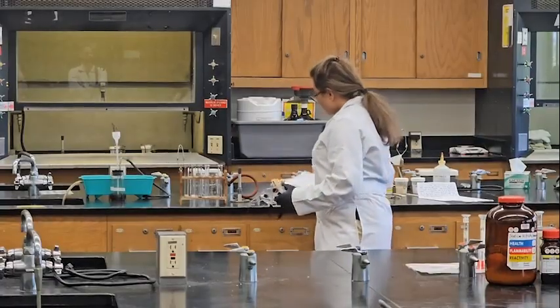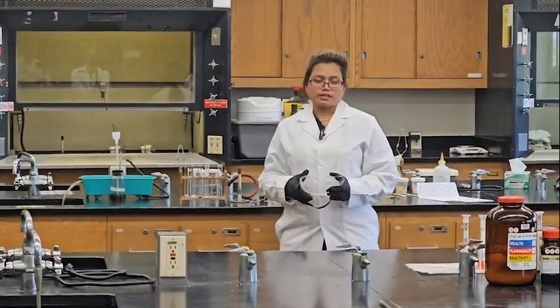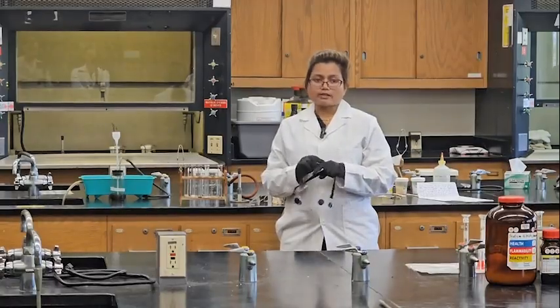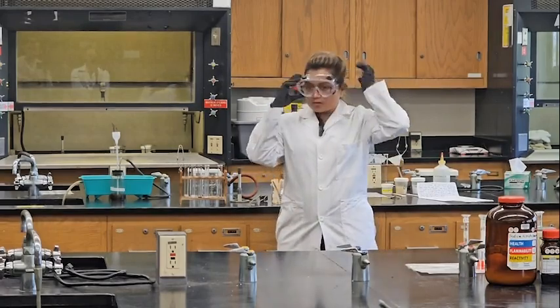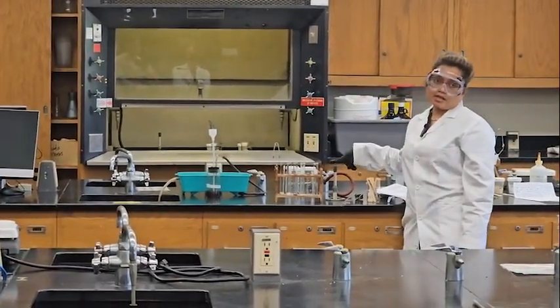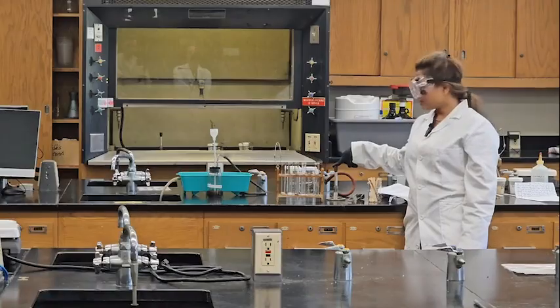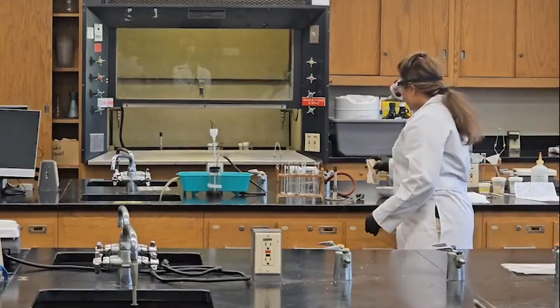As we do the lab, we need the safety protocols we explained before. We need gloves and goggles. Also, whoever has long hair should tie it up, because we are going to use the Bunsen burner. We don't want any harm to happen to you, because it contains fire.